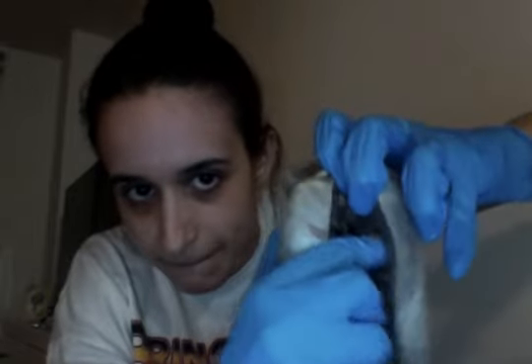Then on the right side now we have the tricuspid valve. That is over here. You can even see how I lose my finger going down it. The tricuspid valve is oxygen poor blood that travels from the right atrium to the right ventricle. So those are the two valves that connect the atria and ventricles, and the blood flows through.